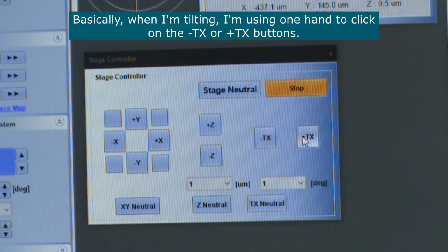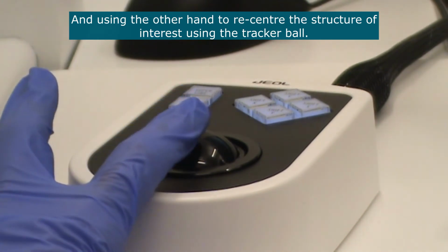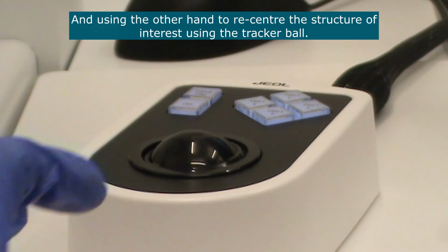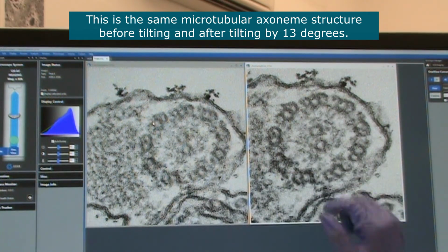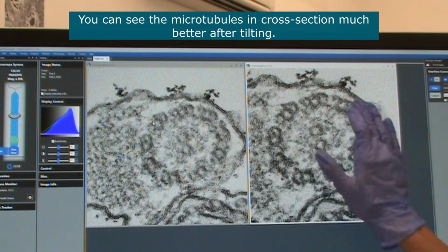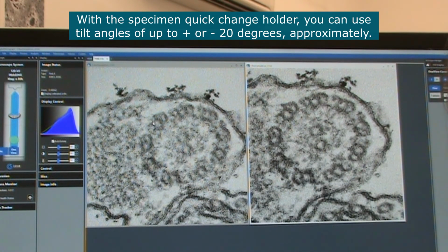So basically, when I'm tilting, I'm using one hand to click on either of these two buttons here, and using the other hand to reposition my sample, bring it back to the center using the trackball. This is the same microtubular axoneme structure before tilting and after tilting by 13 degrees. You can see the microtubules in cross-section much better after tilting. With the specimen quick change holder, you can use tilt angles of about 20 degrees plus and minus.